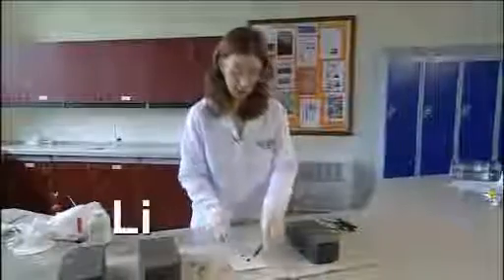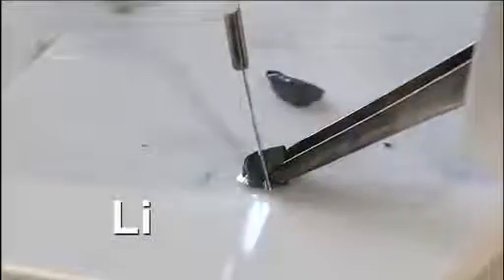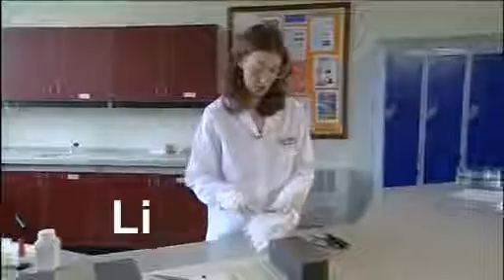Next you will need to cut a 3mm cube piece of metal in order to heat in air. Before we heat in air, you need to dry off the oil from the metal using some paper tissue. We no longer recommend using hexane to dissolve the oil because there have been fires when washing up due to some residues.